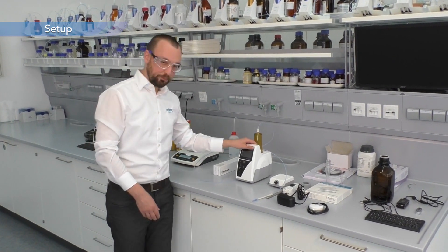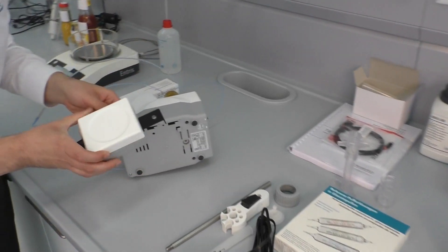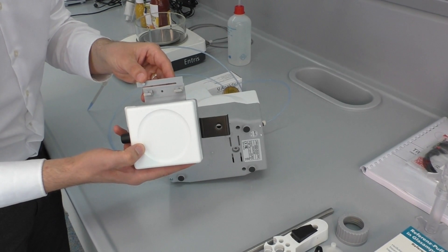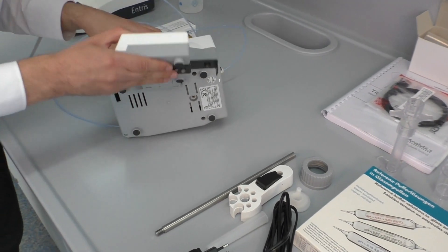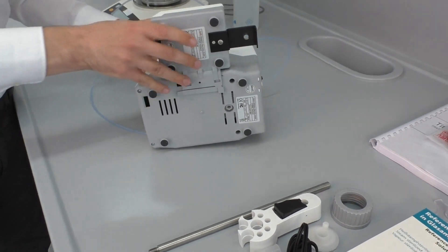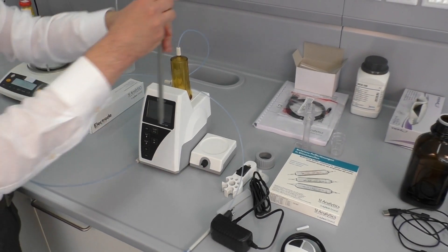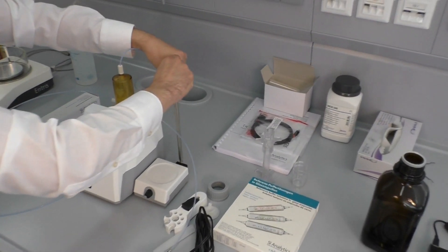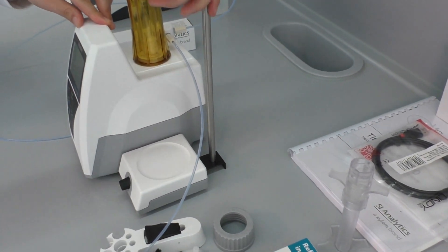After all the accessories are now unpacked, we can start to set up the instrumentation. The first thing to attach is the magnetic stirrer. The magnetic stirrer is run directly by the instrument via these gold contacts.